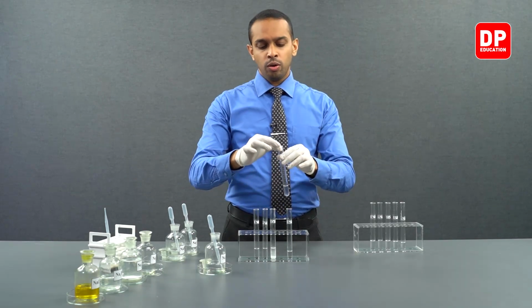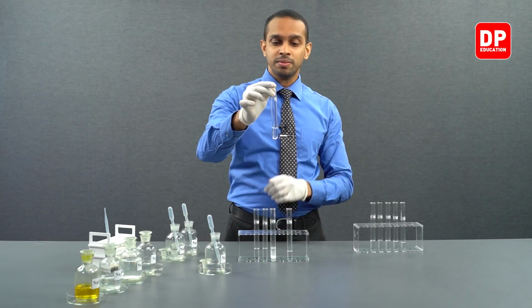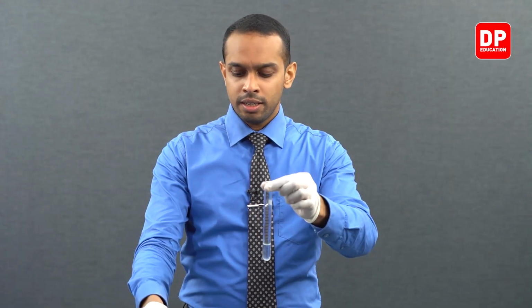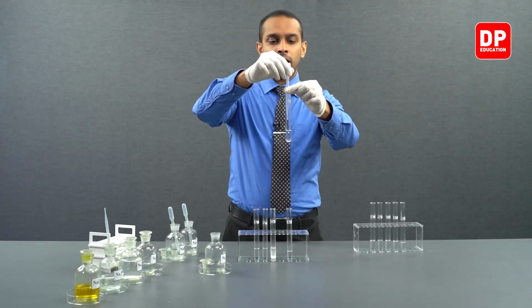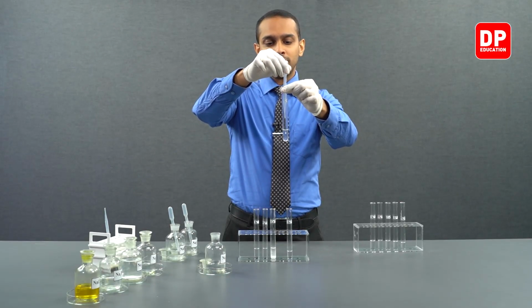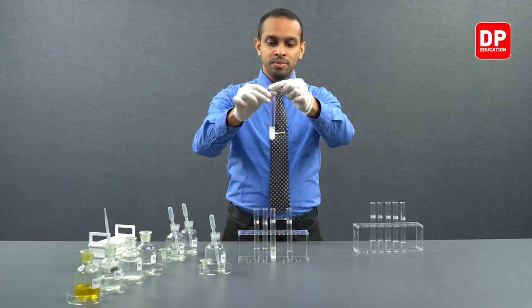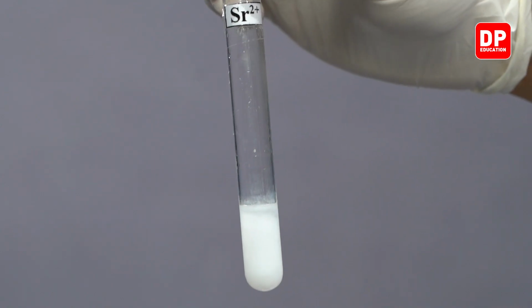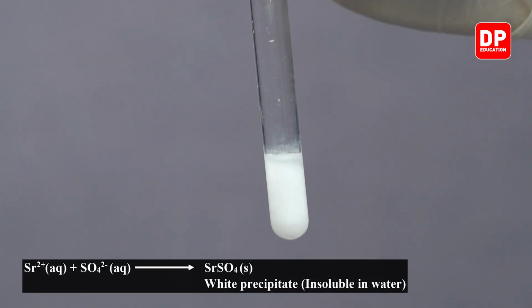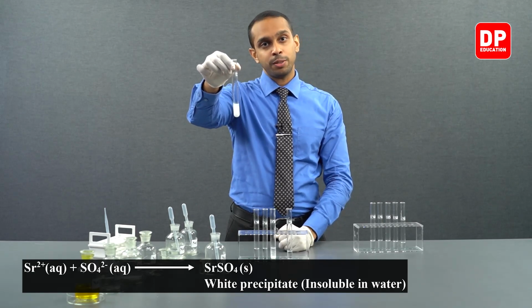Now, we are moving on to strontium 2 plus aqueous ion solution. Let's add a few drops of sodium sulfate. So now I'm introducing sulfate ions into our strontium 2 plus ion solution. As you can see, as soon as a small amount of sodium sulfate was added to strontium 2 plus ion solution, we started forming a white color precipitate.